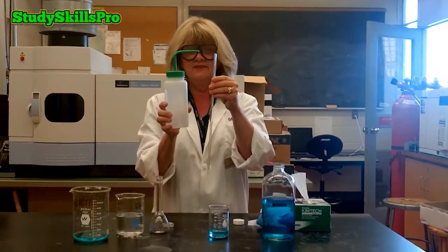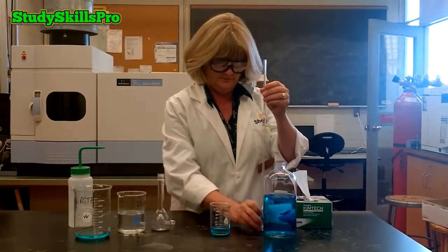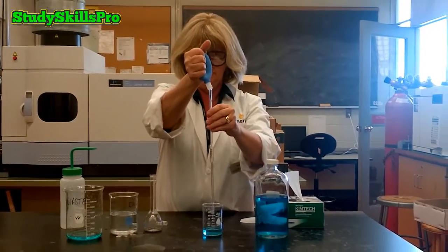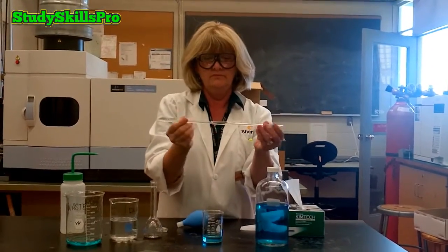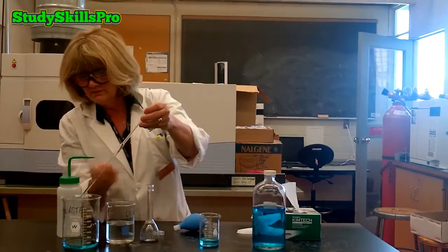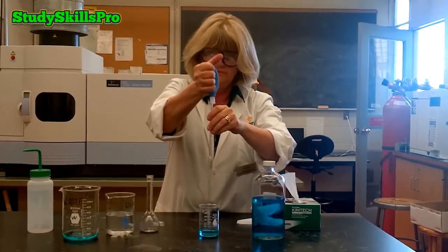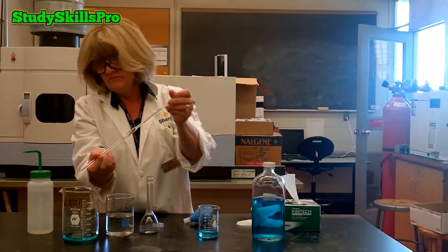You can now prepare to pipette your stock solution. Again, we must first analytically rinse our volumetric pipette. You would first rinse 3 times with RO water. After rinsing 3 times with RO water, you are going to rinse your pipette 3 times with the stock solution. The final rinse of your volumetric pipette must always be with the analyte solution that you are about to pipette. In order to analytically rinse your pipette, draw up a small volume of the stock solution into the pipette.